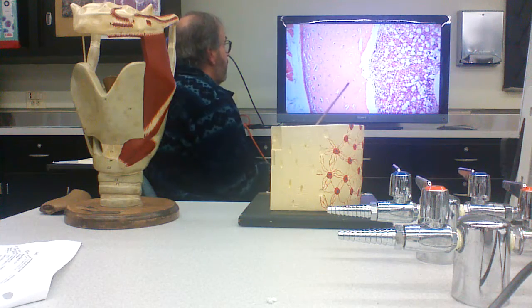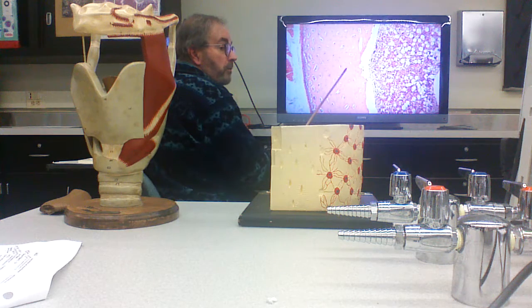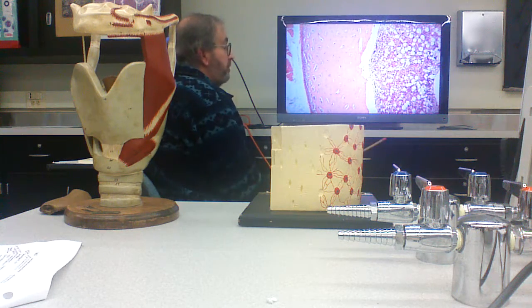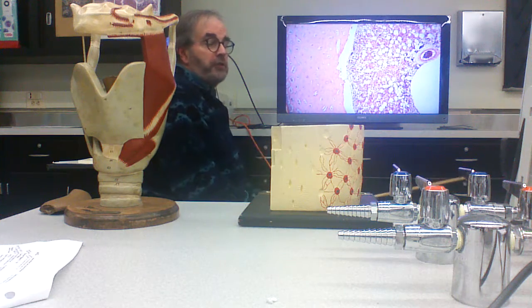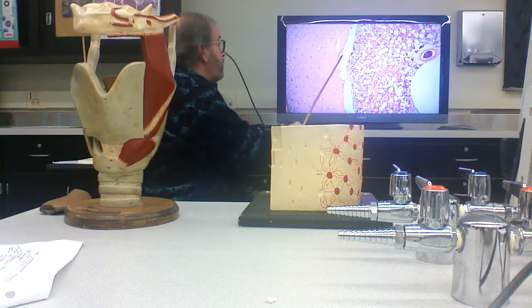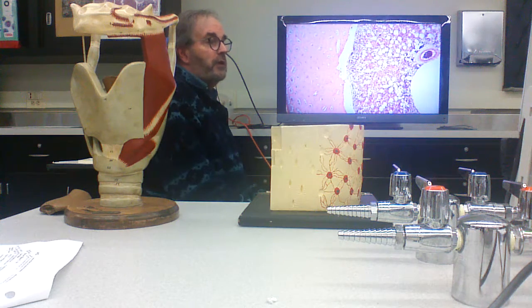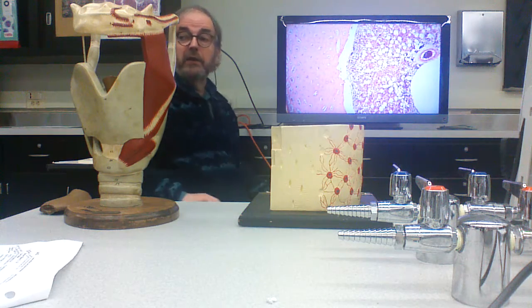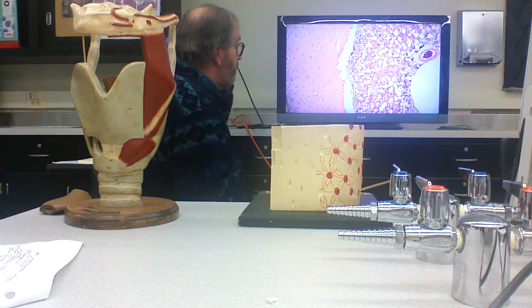Now, this is the shaft of a bone. It's compact bone. The shaft generally is made out of compact bone, with the exception that there could be some trabeculae coming off. And these trabeculae are basically going to serve as internal struts. They're going to support, for instance, the cylinder of the diaphysis.